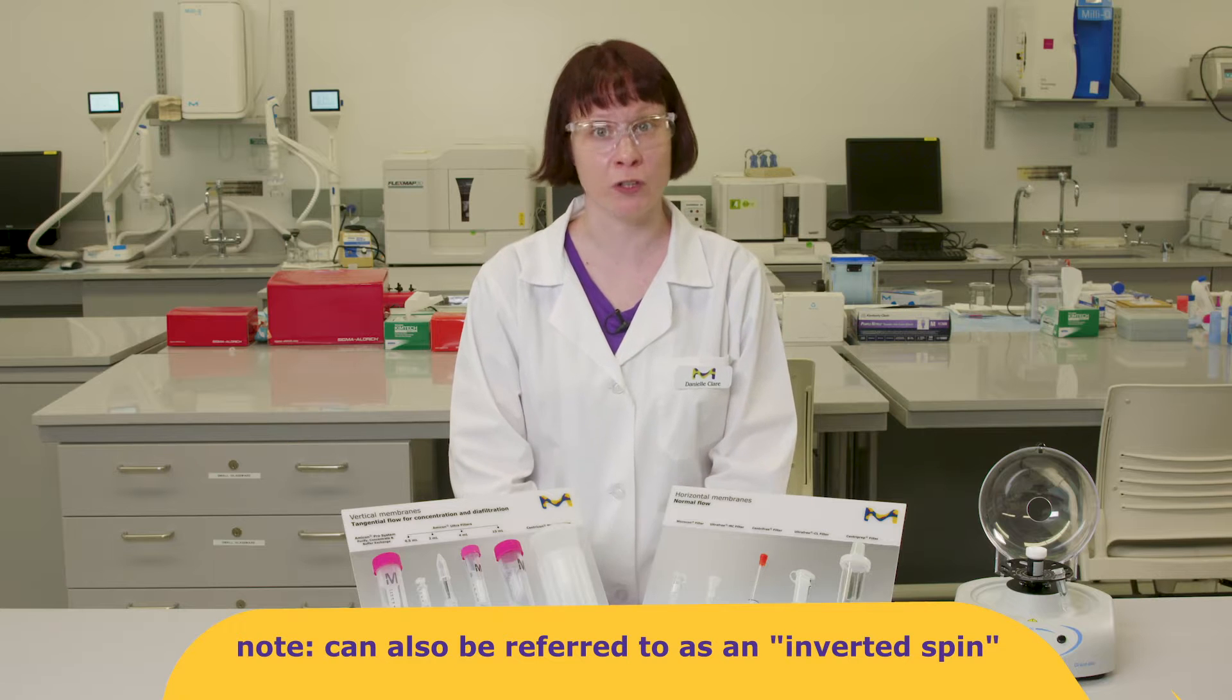Hello, my name is Danielle, and today I would like to explain to you how to get maximum recovery from your concentrated samples using a technique called reverse spin.